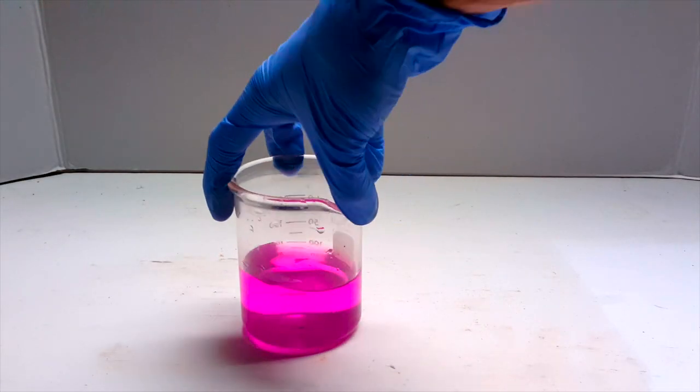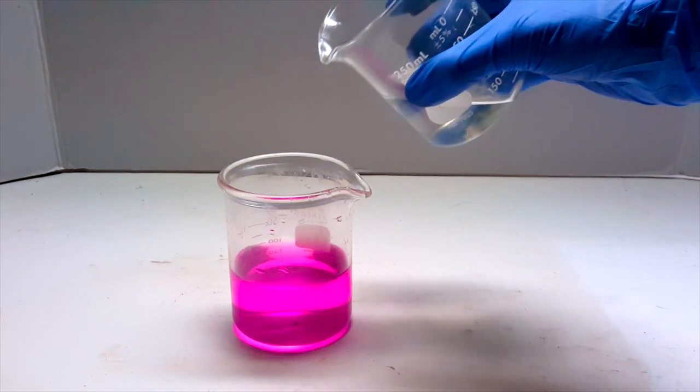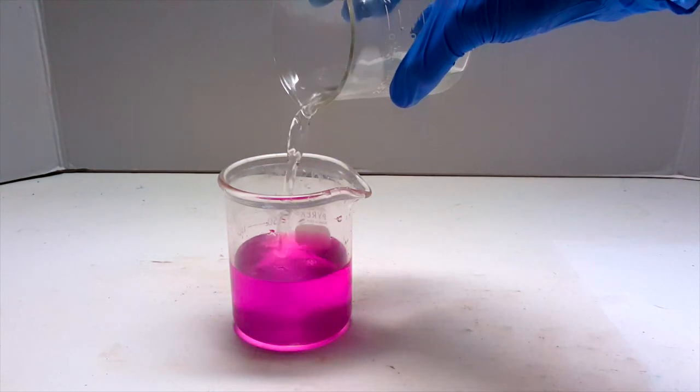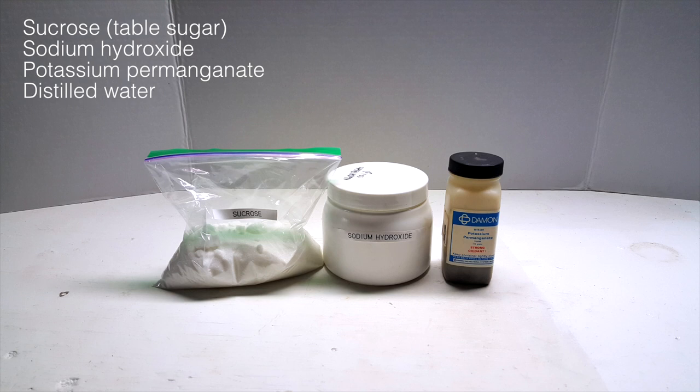Today I'll be exploring the chemical chameleon demonstration, which is pretty commonly performed in high school chemistry classes. I'm going to break down each step of the process, which I haven't seen done online yet. To do this experiment, we'll need three easily obtained chemicals.